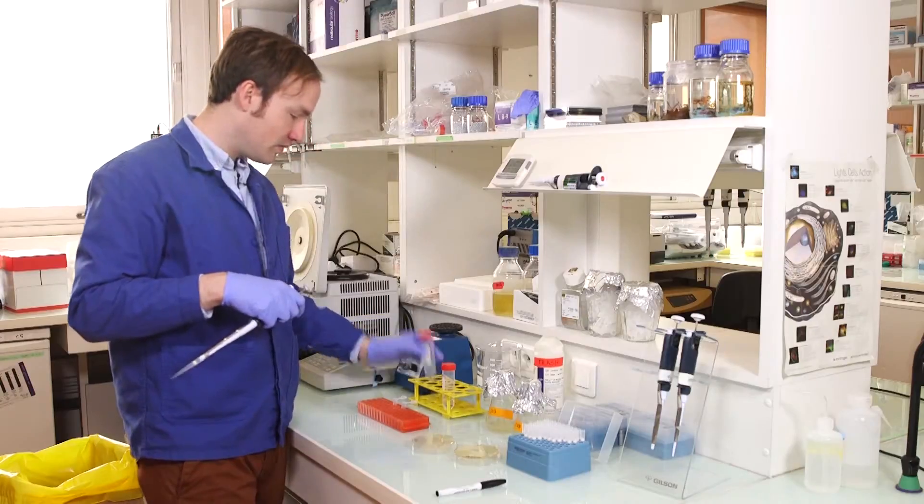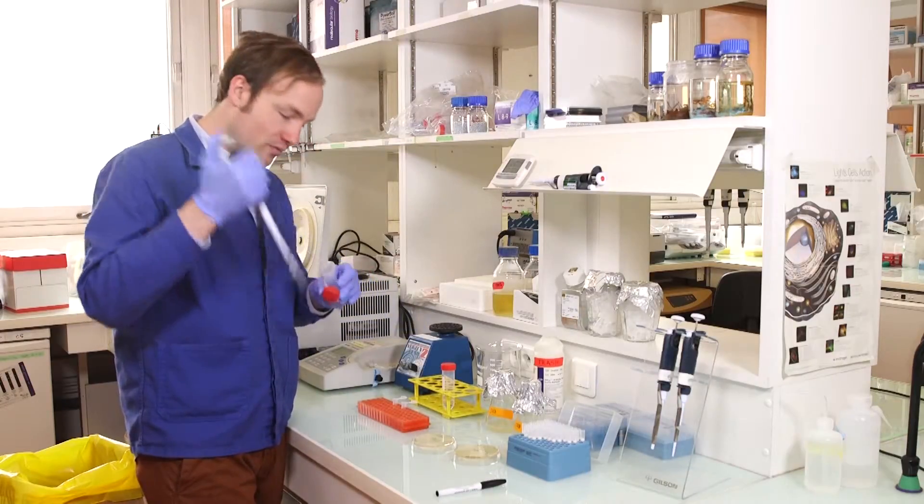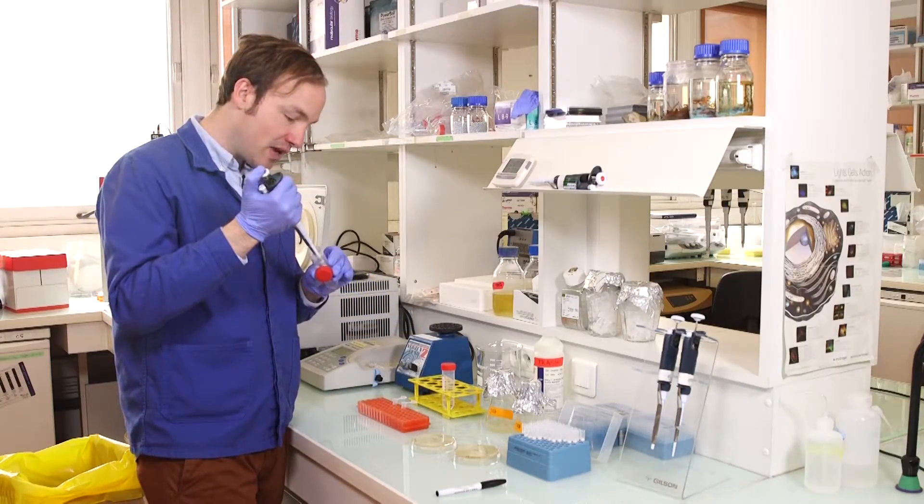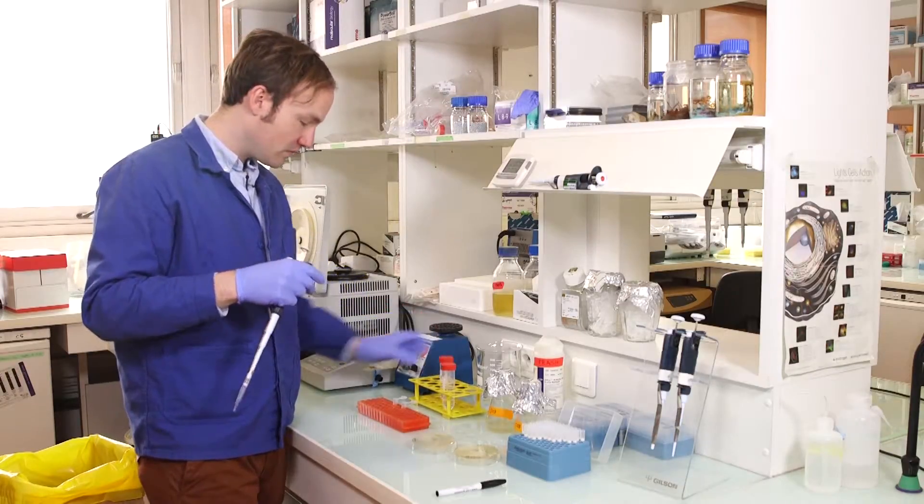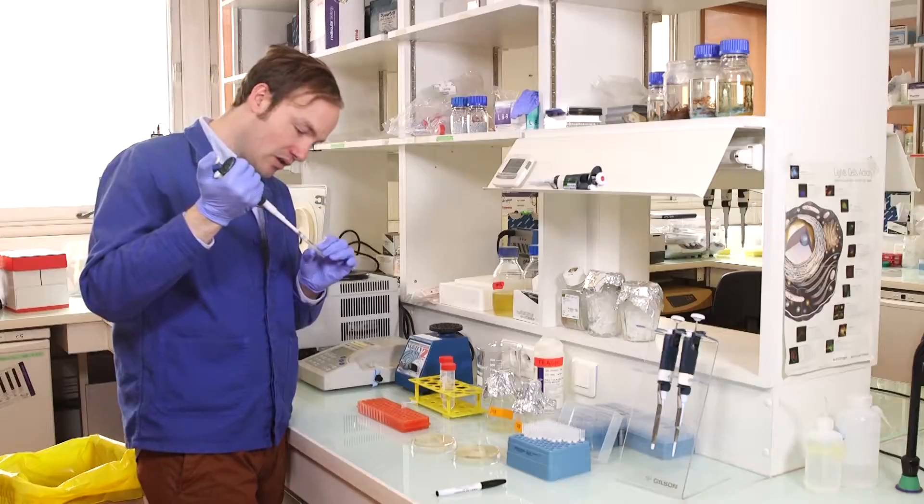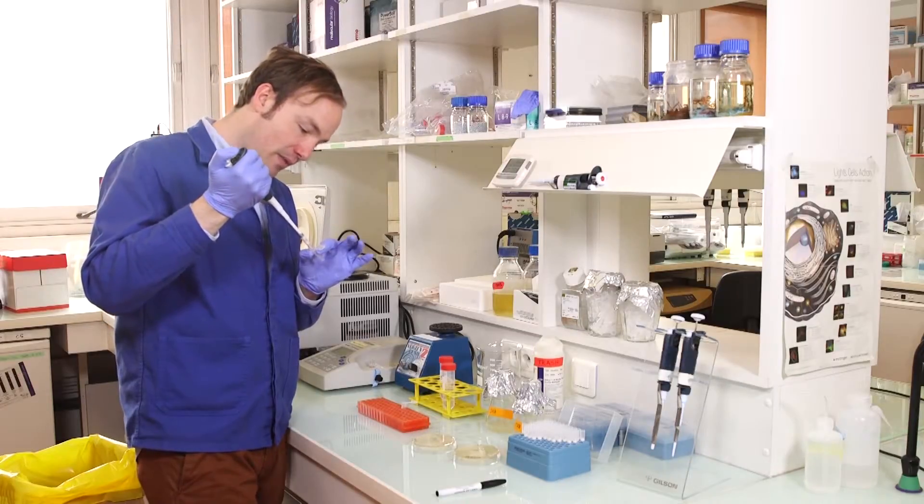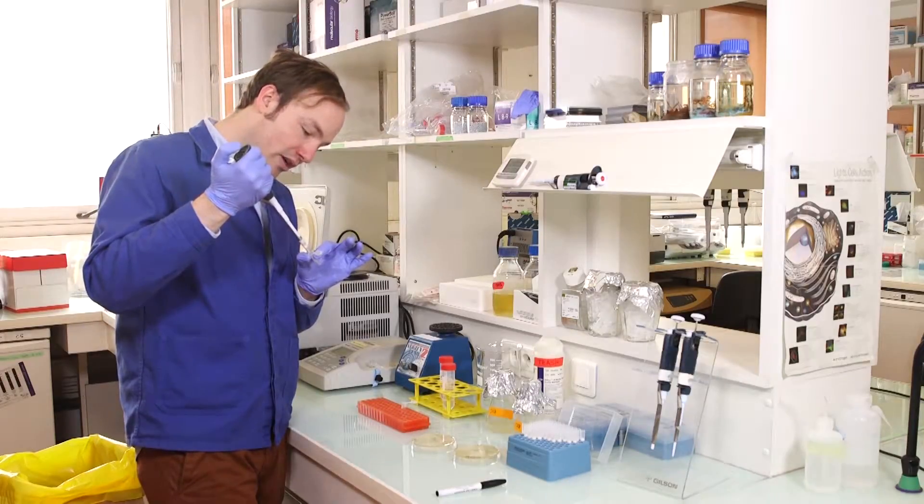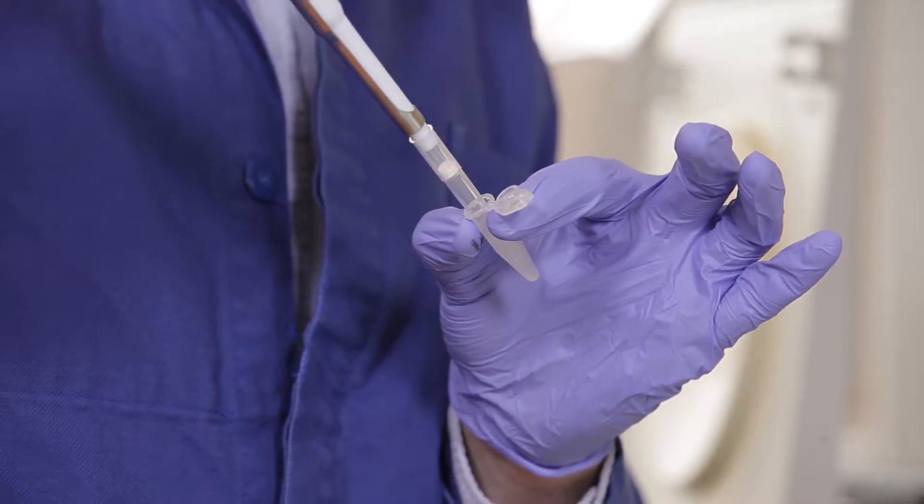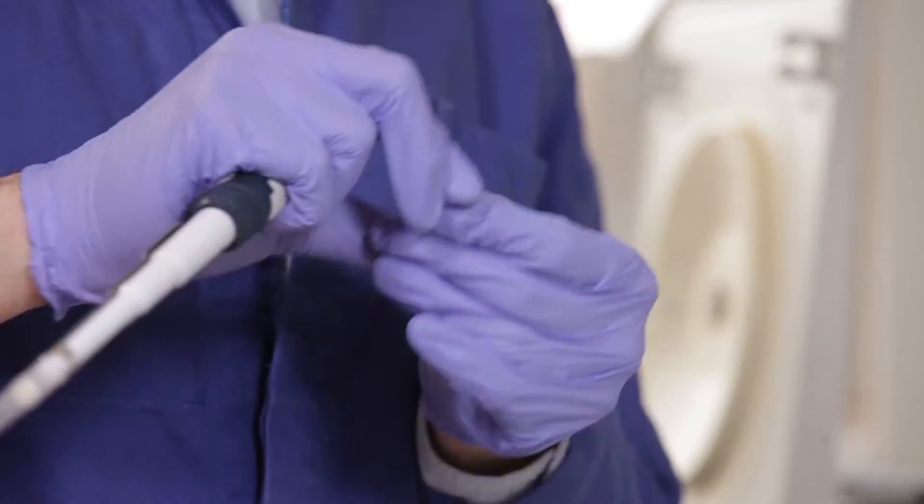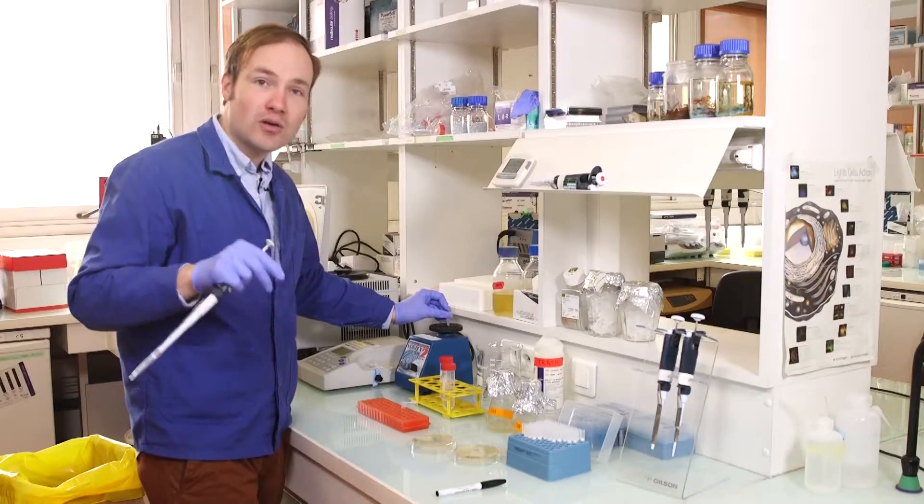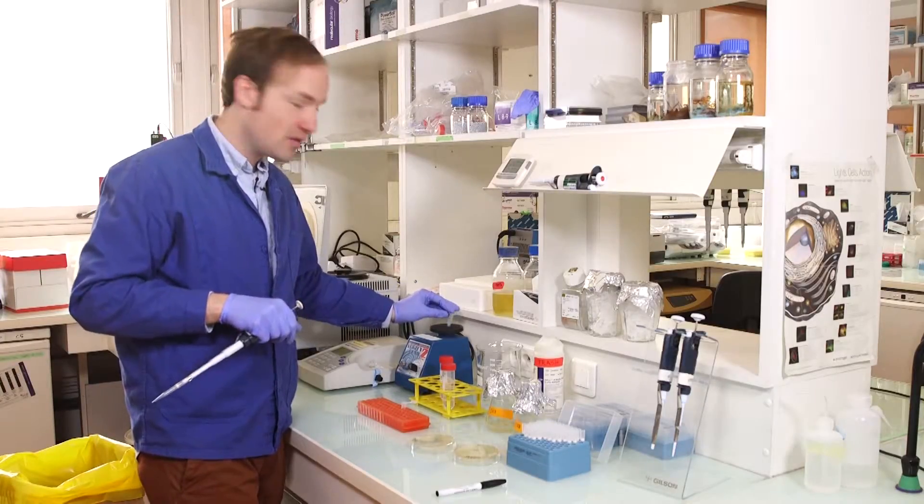Now we resuspend equal volume of PBS. You'll notice that I pipetted that up and down to break up the pellet. And then vortex, just to make sure all the cells are completely homogenous in the PBS.